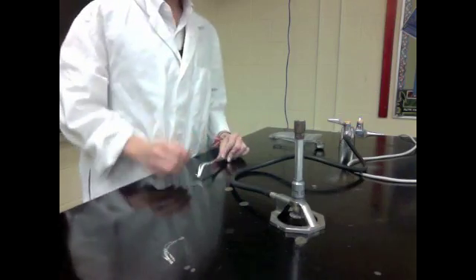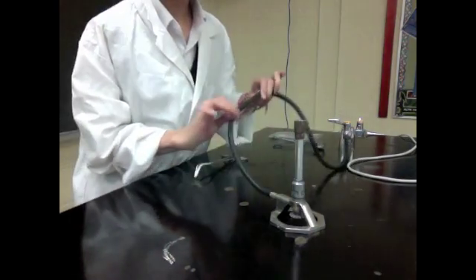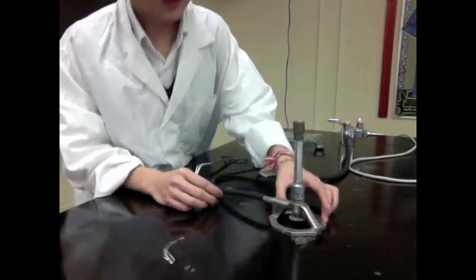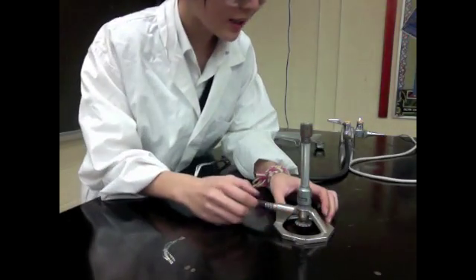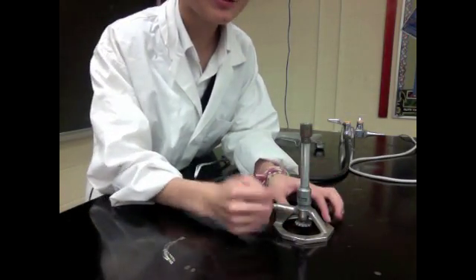So here are some rules to lighting the Bunsen burner. After making sure that the rubber tubing is safe, you want to take note of the gas valve here that allows the amount of gas that goes through the Bunsen burner.